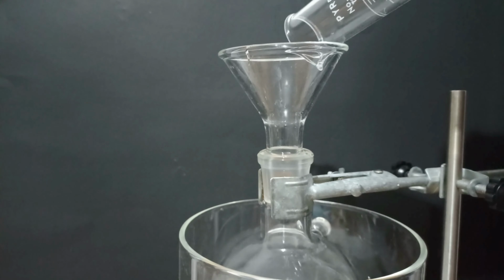Then the oxygen atom forms a double carbon-oxygen bond, kicking away p-aminophenol and forming the protonated form of acetic acid. And for the last step, the amino group takes the proton of the protonated form of acetic acid or from hydrochloric acid, forming our p-aminophenol hydrochloride product.